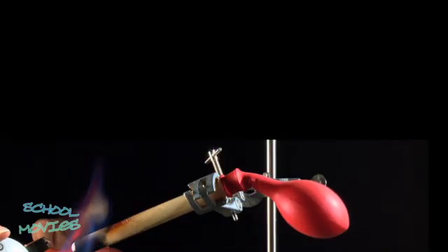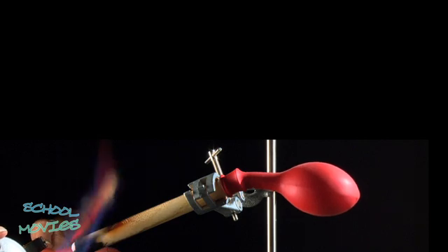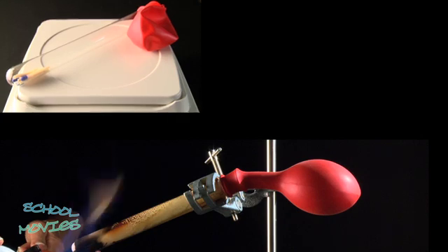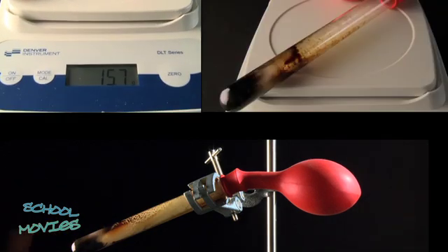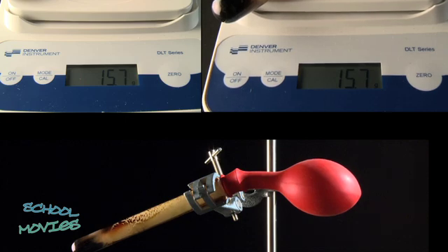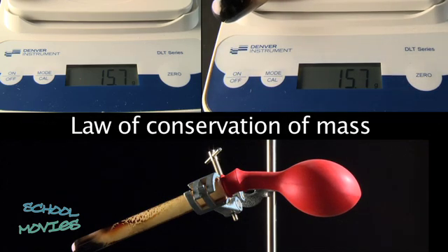To verify this, the test tube is sealed in a balloon, so that the experiment can take place in a closed system. The test tube is weighed before and after the reaction. The result? The mass remains the same. This is called the law of conservation of mass.